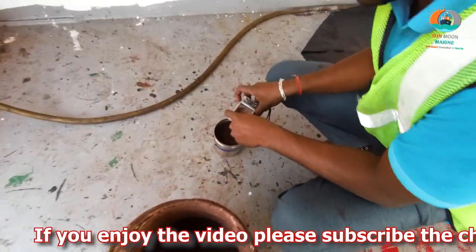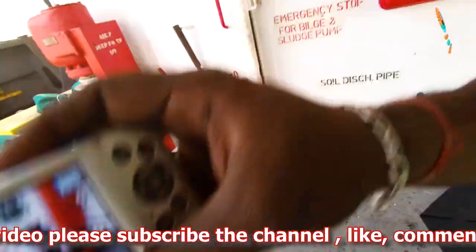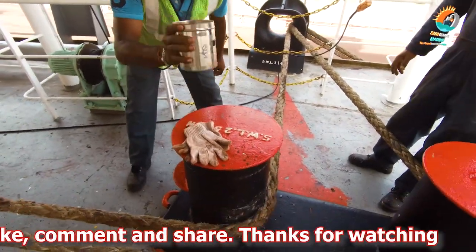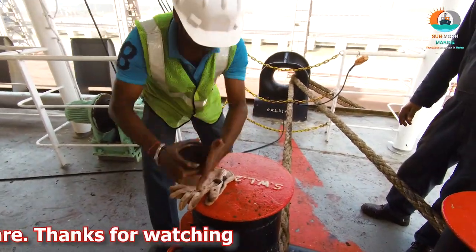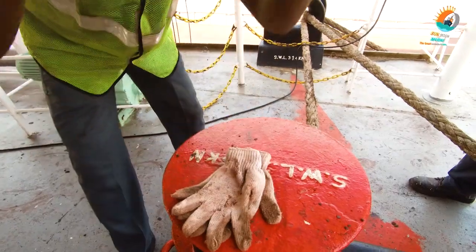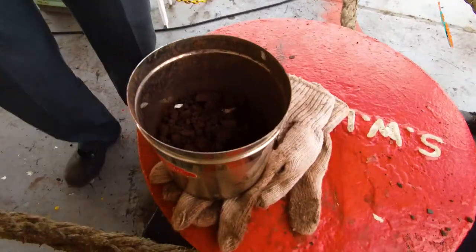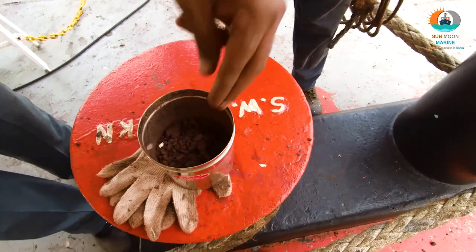There should be photographic evidence for every step. Take the can in one hand and bring it down sharply to strike a hard surface such as a solid table from a height of about 0.2 meters. Repeat the procedure 25 times at one to two second intervals. Examine the surface for free moisture or fluid conditions.